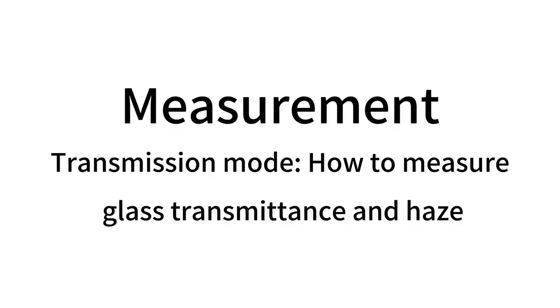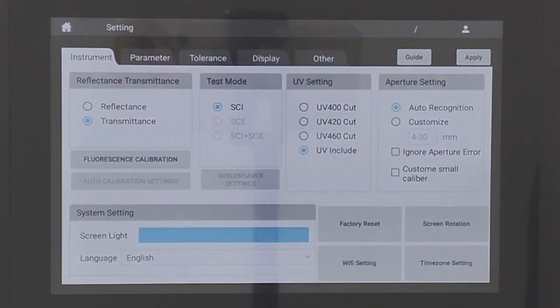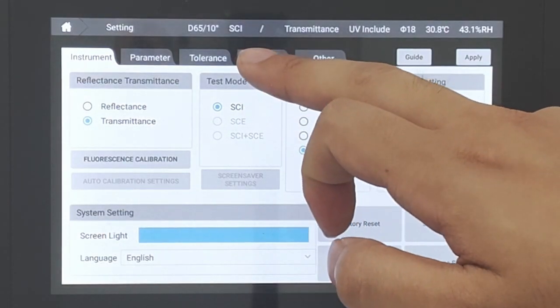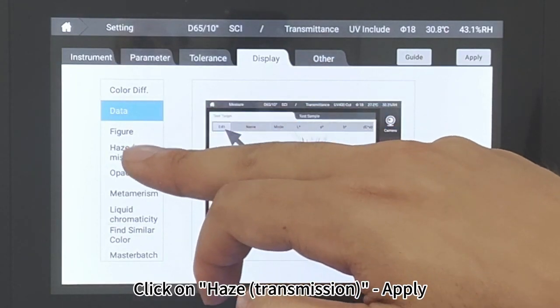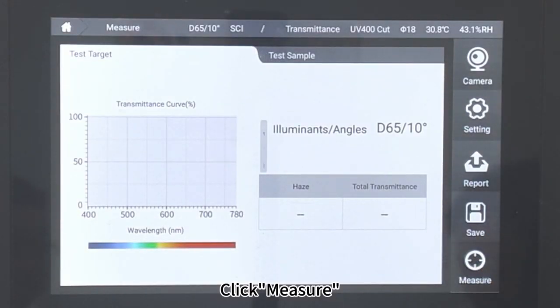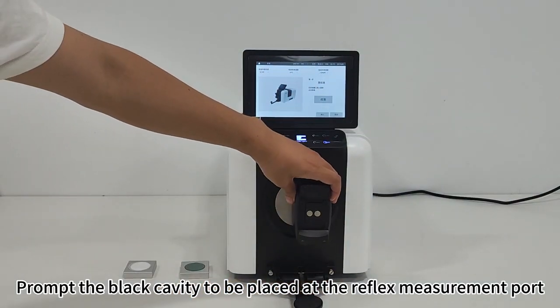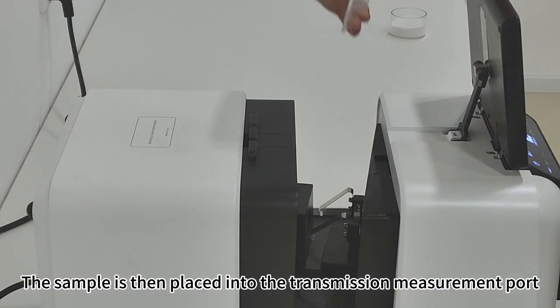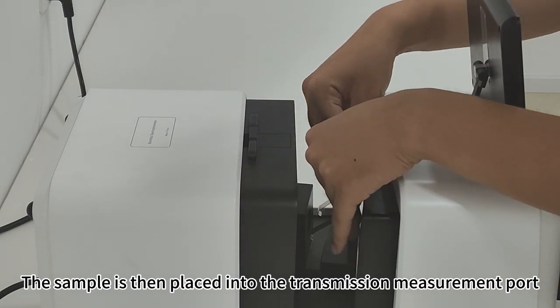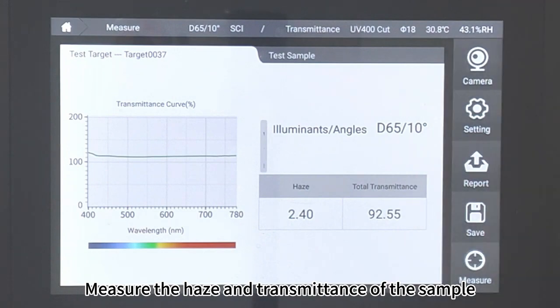Measurement, transmission mode, how to measure glass transmittance and haze. Click Setting. Click Display. Click on Haze Transmission. Apply. Click Measure. Prompt the black cavity to be placed at the reflex measurement port. Click Enter. The sample is then placed into the transmission measurement port. Click Enter. Measure the haze and transmittance of the sample.